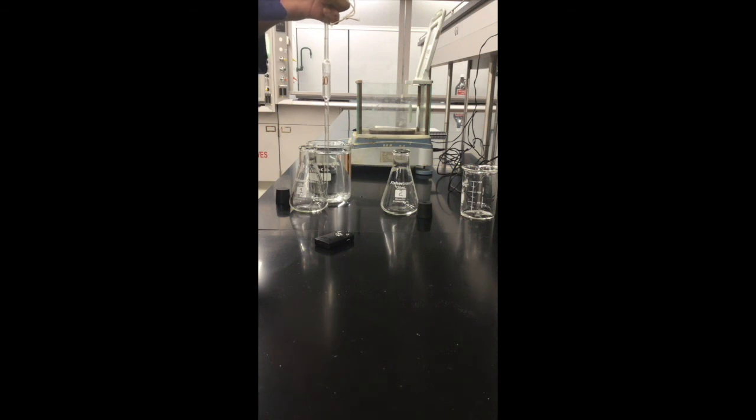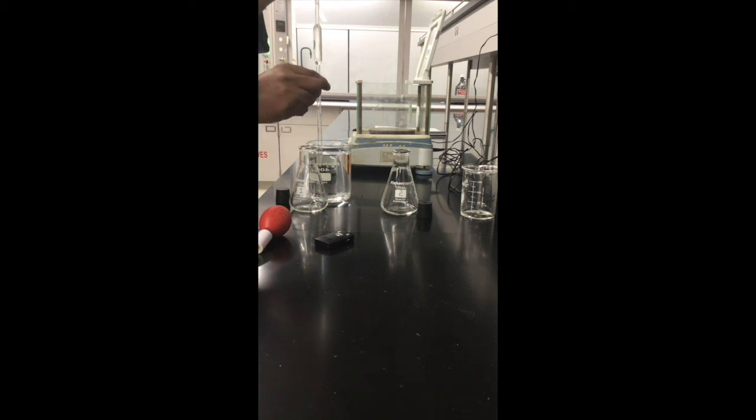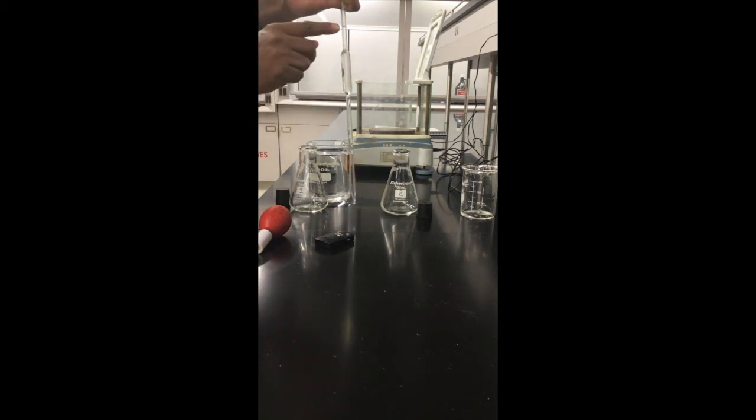It's not yet there, it's still going up. It's past that, so I need to fill one more time. Let's see how far it's going to go. Yeah, it's gone past that, that's fine. So I'll adjust using my thumb until the meniscus is right by the calibration mark. I'll release slowly, slowly, stop right there. If you see clearly, the calibration mark is right there.